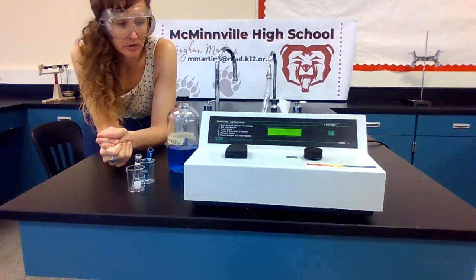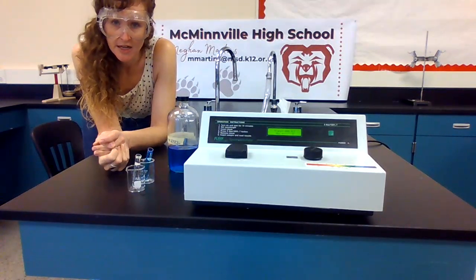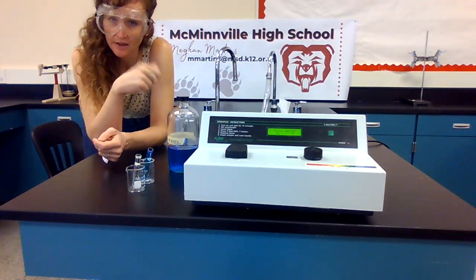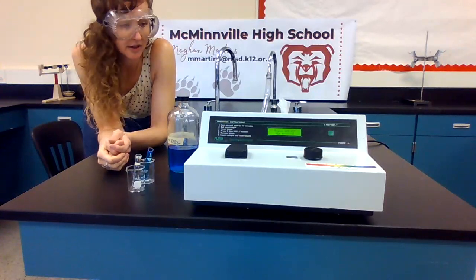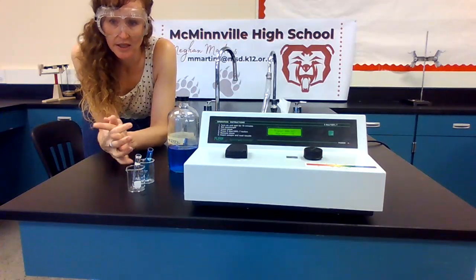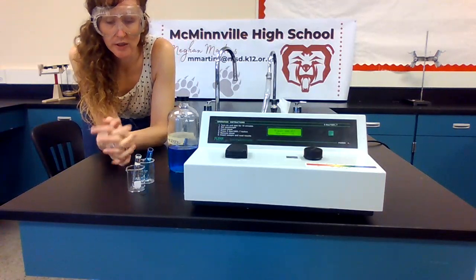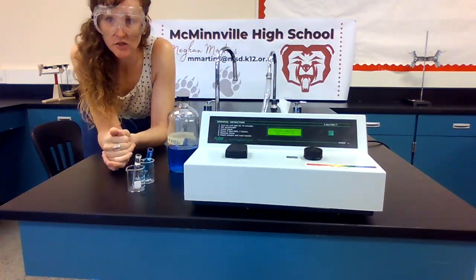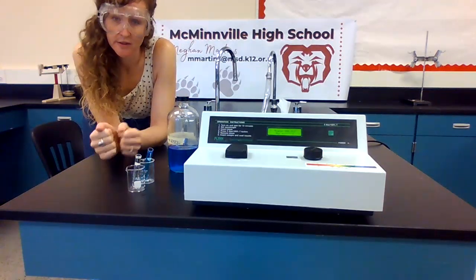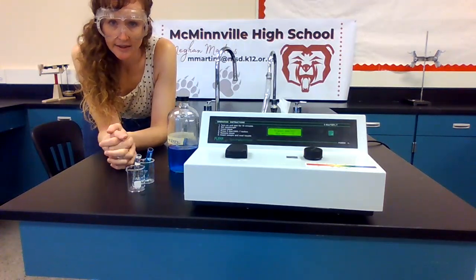Okay, so I'm going to zoom you in so that you can read the spectrophotometer yourself, and you will be able to see me change the wavelength. I'll tell you what wavelength I'm at, and you're going to want to write down what the absorbance is. Now, the purpose of doing this is so that we can create a spectrum, and from that spectrum we can evaluate it and figure out what the best wavelength is going to be in order to absorb copper 2 nitrate. We'll talk about what's doing the absorbing and how we know that.